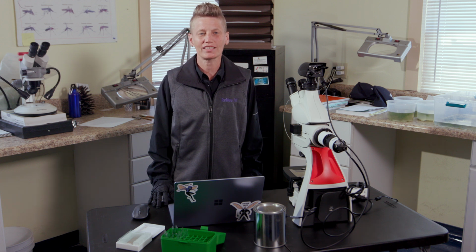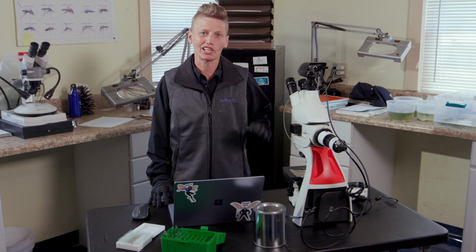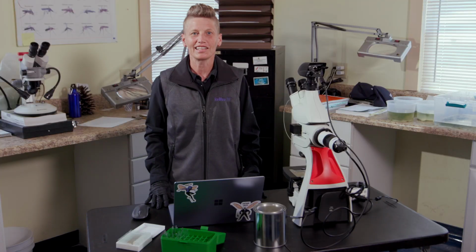When using A-Drop, it is important that you have the correct type of microscope, UV light, and digital camera to collect the droplet images. The initial setup steps have been completed. To center the microscope, select the UV light intensity and select the proper lens. In addition, the microscope program has been downloaded on the computer and the settings set for A-Drop. After the droplets have been collected, you're ready to go.